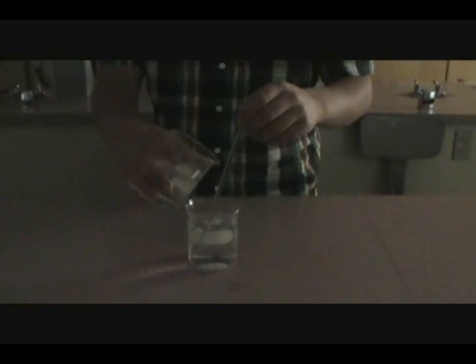They were never the same again. Never add water to acid. Oh my gosh!